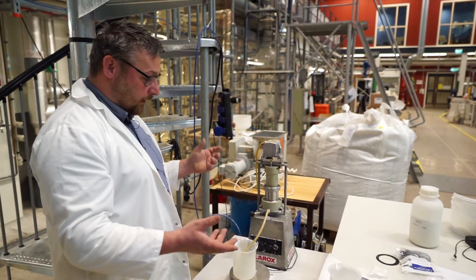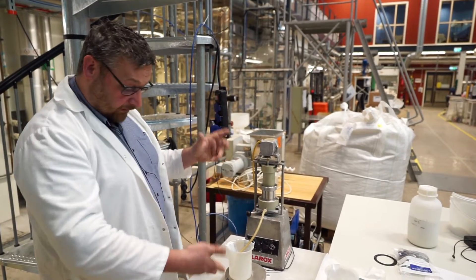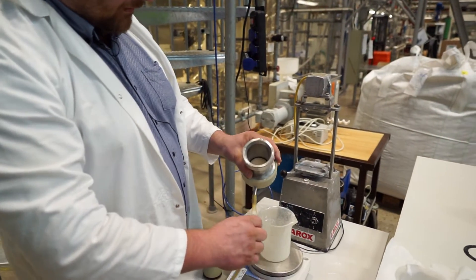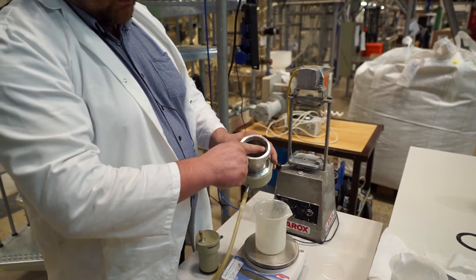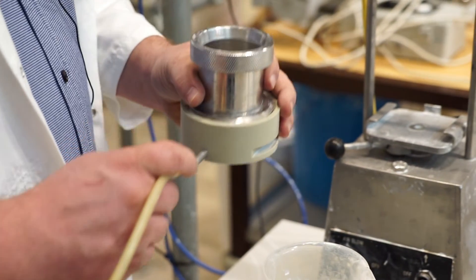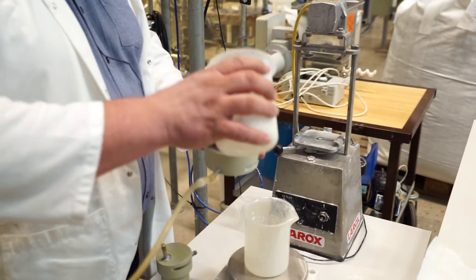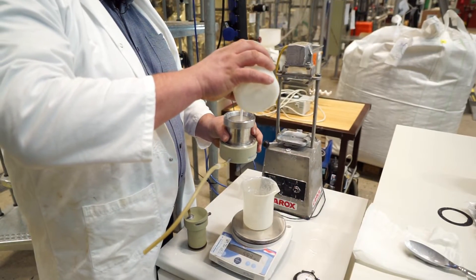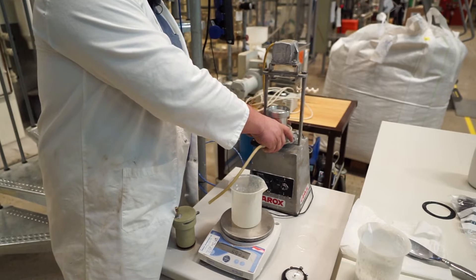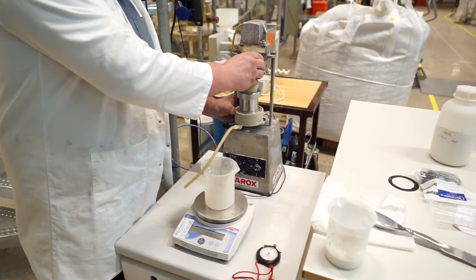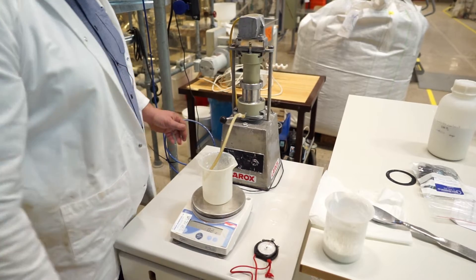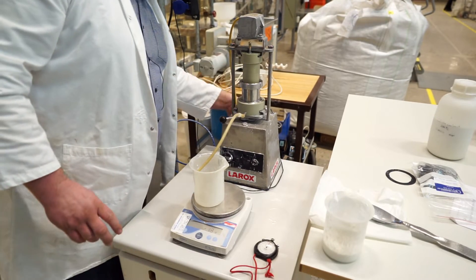So I'll put it together and start the filtration and we will see if we get a filtrate. So now we're going to fill in the calcium carbonate solution up until about half a centimeter below this part here and assemble the rest and start the experiment. Calcium carbonate solution, very milky in consistency, almost. Put everything in place, the holes where they're supposed to be. And the thing at the back, and the thing that we forgot the last time we did this, a little stop here at the back.